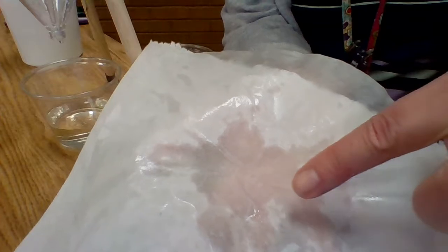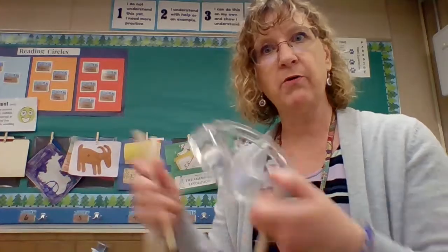And we can see the solute on the paper towel, maybe. I don't know if you can see that. But there's little bits right here that are still the solute that did not come through the funnel because, of course, we filtered it. And that's what we wanted, right? The remaining solute that didn't dissolve, we want that in our filter. All right, so now we need to weigh this because we need to figure out how many grams of this mystery substance were dissolved and reached saturation.